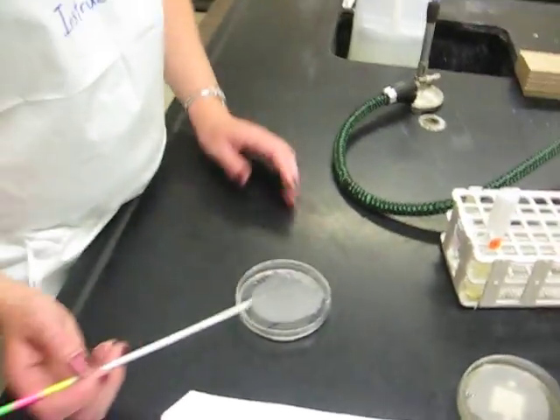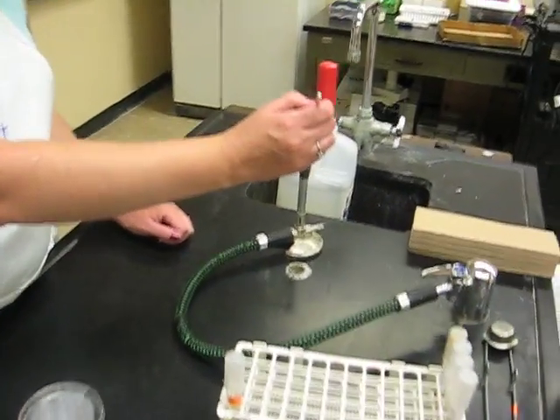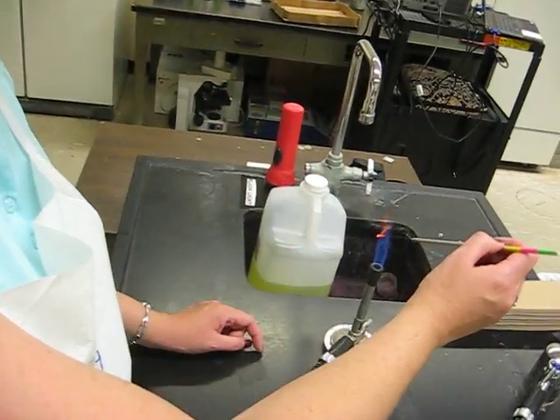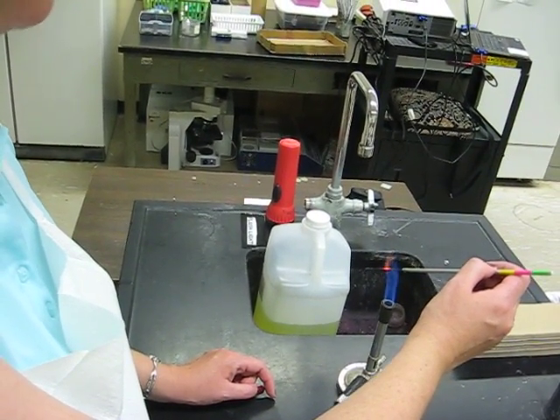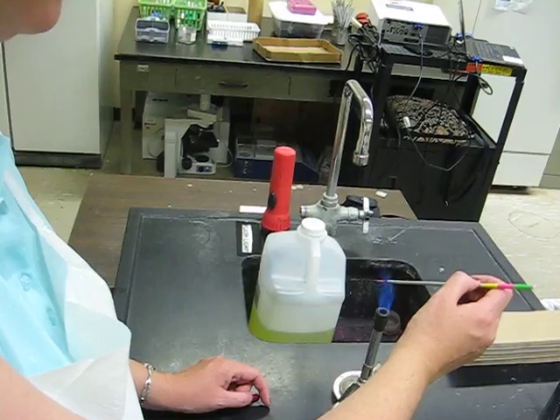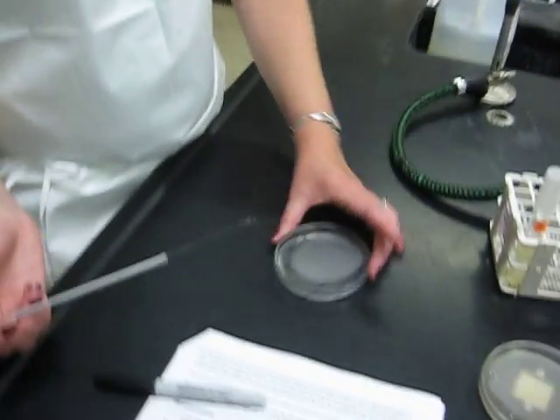Pick up my loop. Cover it. Flame. I'm killing all the bacteria. So the only bacteria I'm going to pick up are ones that have already spread on my plate, because I just killed any on my loop. Turn my plate again.